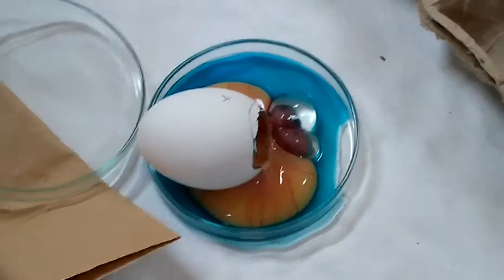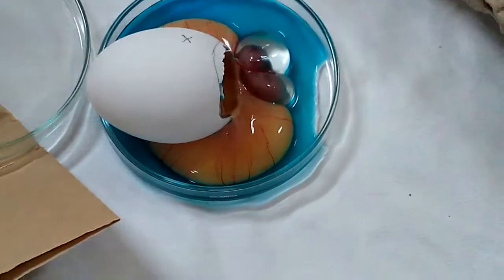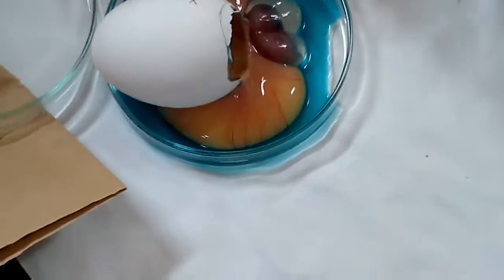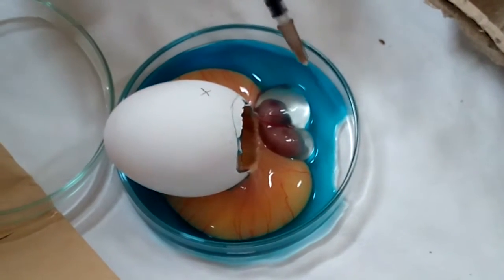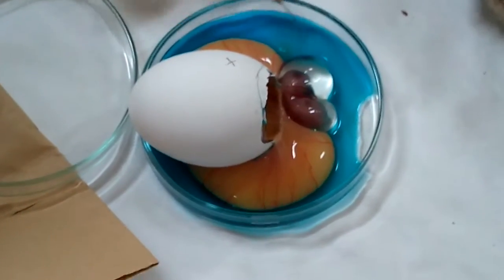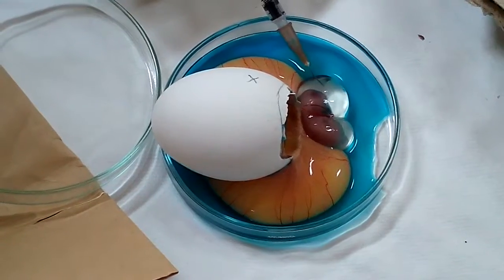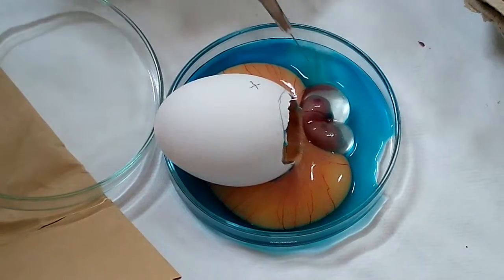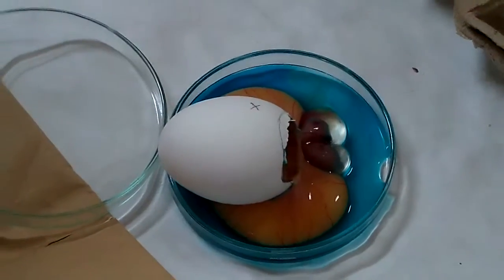You can harvest this fluid. How is amniotic fluid harvested? Can you tell the parts again? This is yolk sac. This is amniotic cavity. The fluid which has come out is allantoid fluid. Now we will harvest amniotic fluid — this is a clear fluid which is the amniotic fluid. This can be a source of virus when you inoculate in the amniotic cavity.